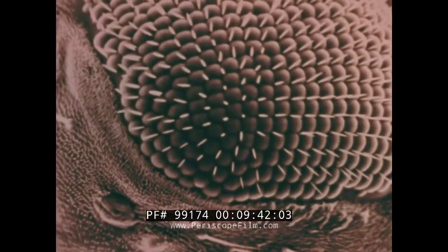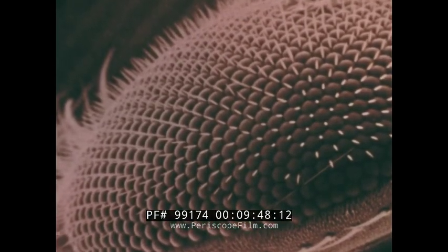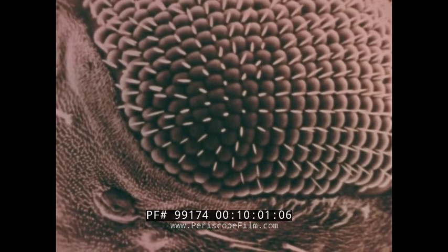Like most insects, it has a compound eye. It also has an array of spines among the visual units. We can understand this arrangement at once, immediately, intuitively. What we can begin to grasp is the functioning of part with part, the connections, the architecture of living tissue.